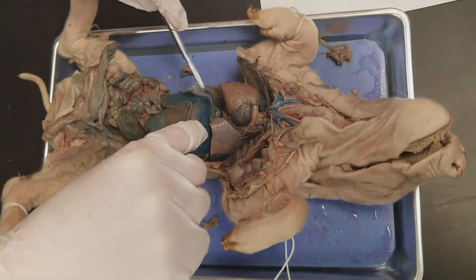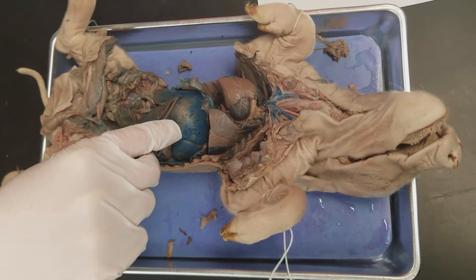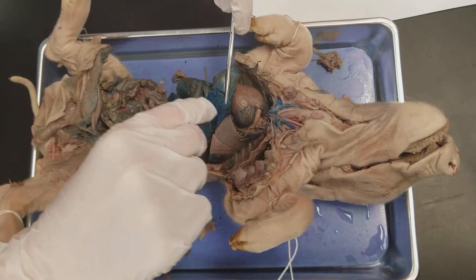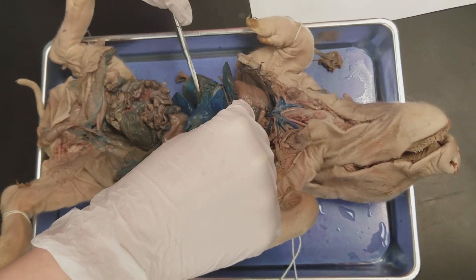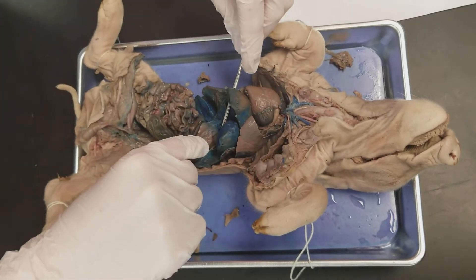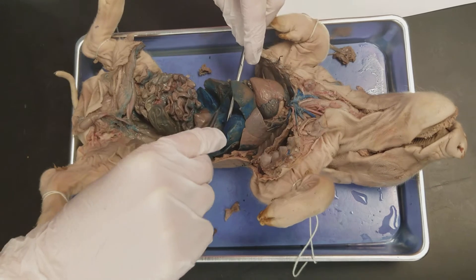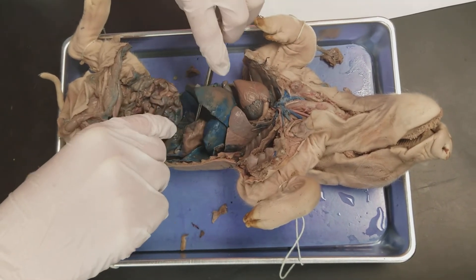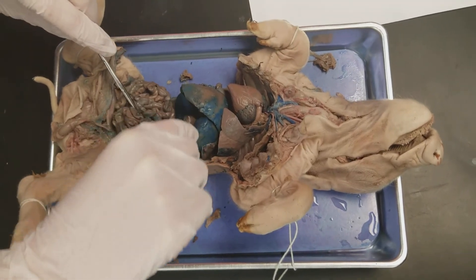The liver is this entire structure along here — it's really big. The gallbladder is underneath the liver; the gallbladder is right here, it's this little sack right there. The cystic duct connects the gallbladder right here, and the hepatic ducts are from the liver right here. They come together to form the common bile duct, which is on the duodenum.